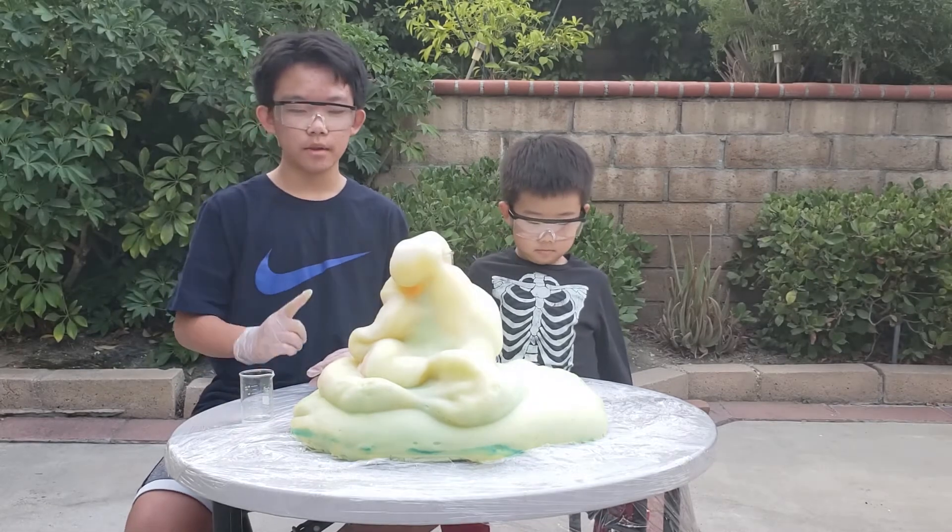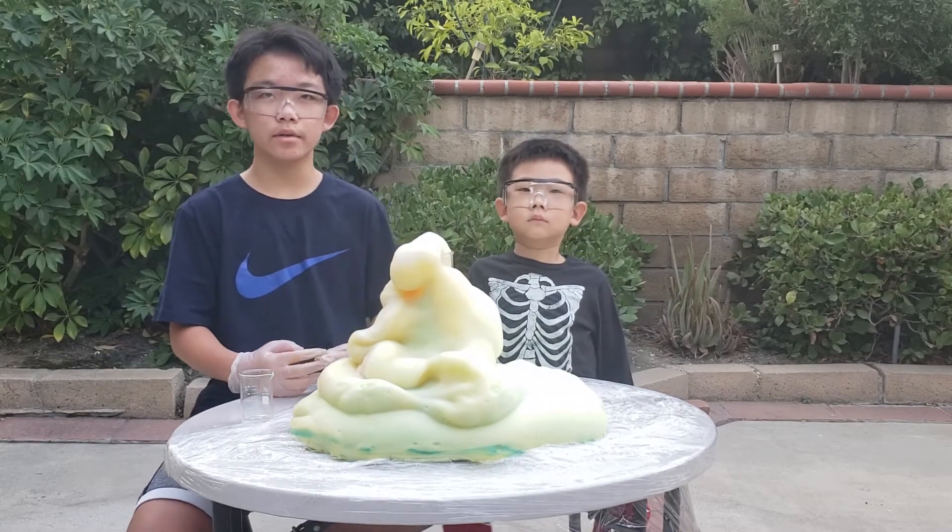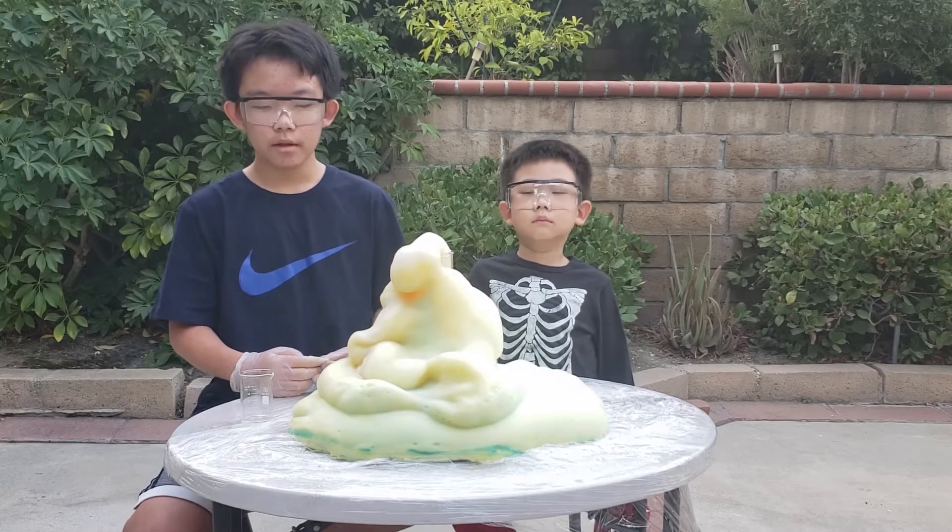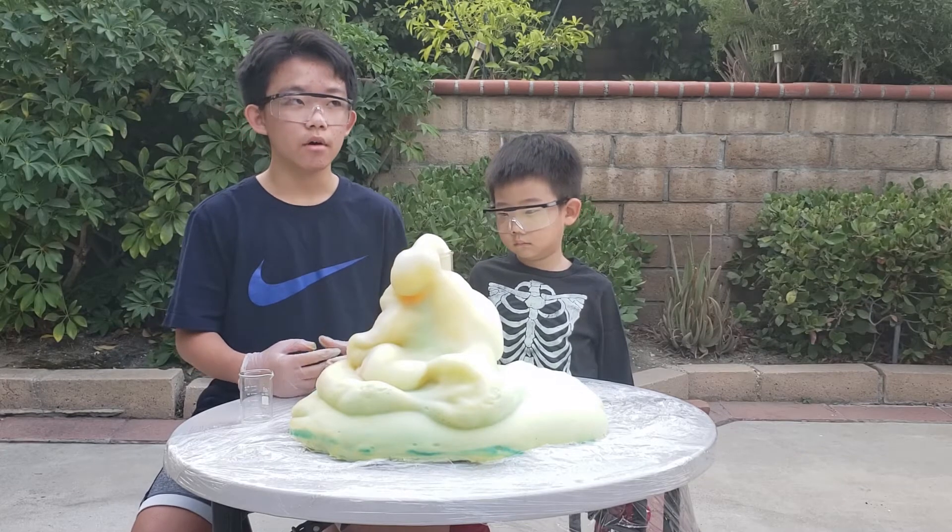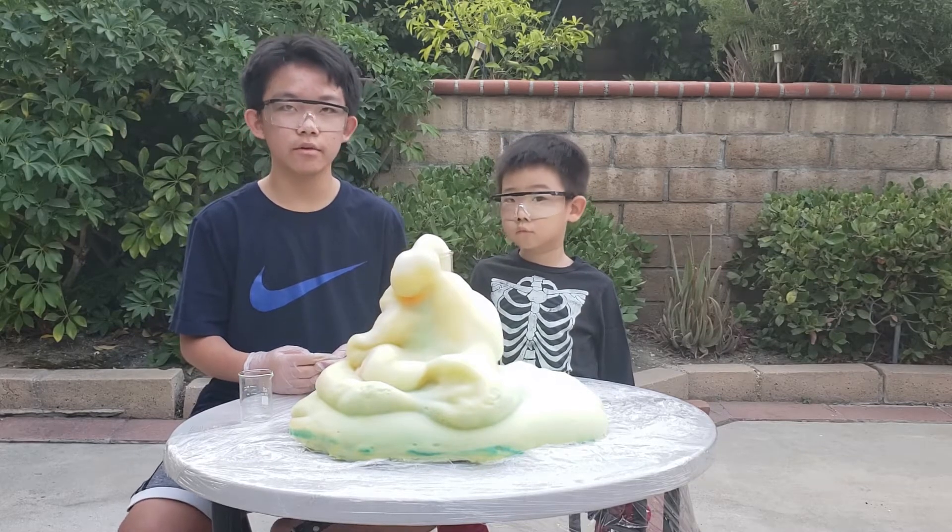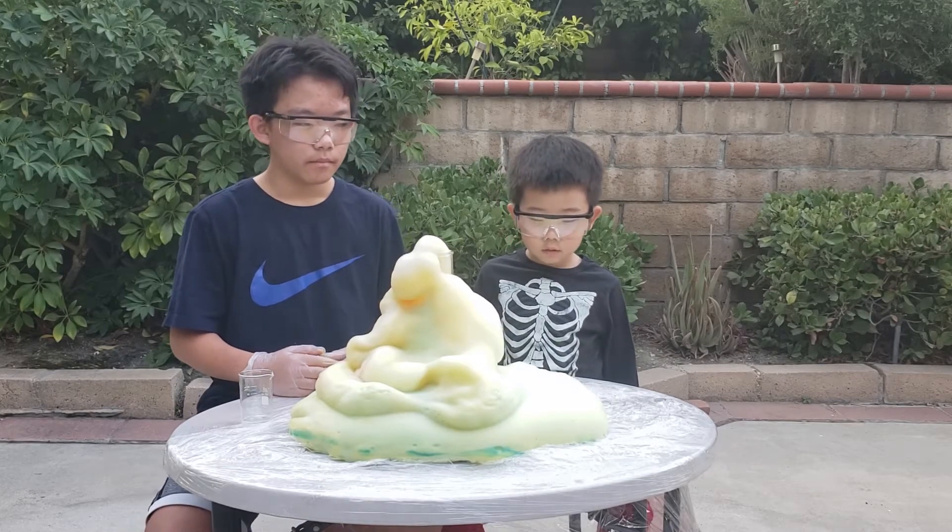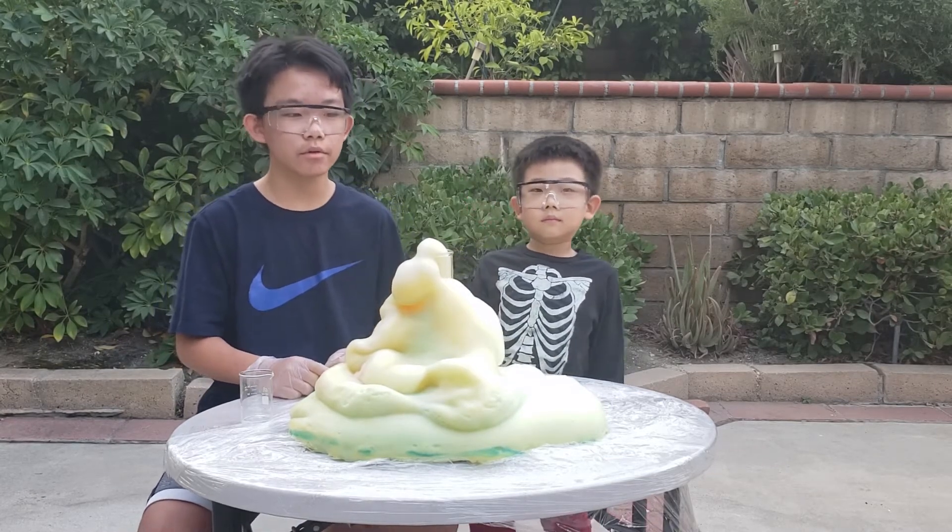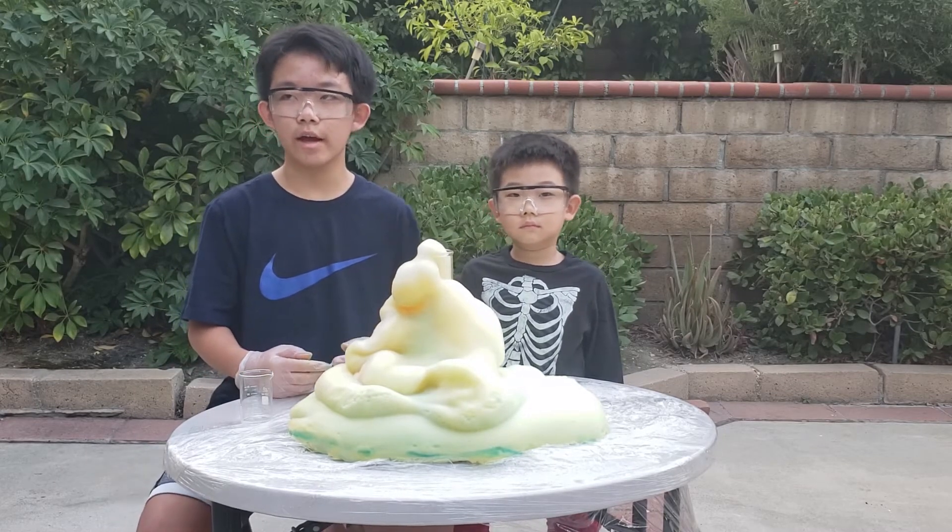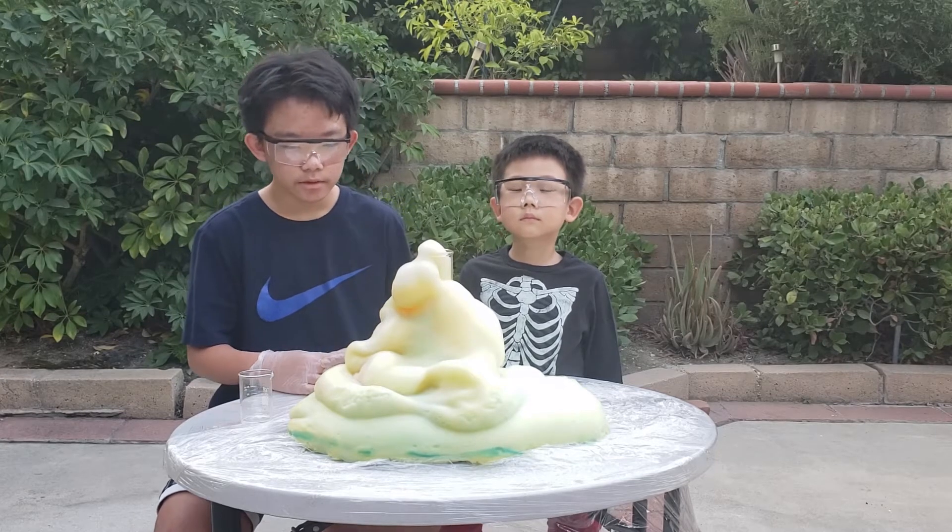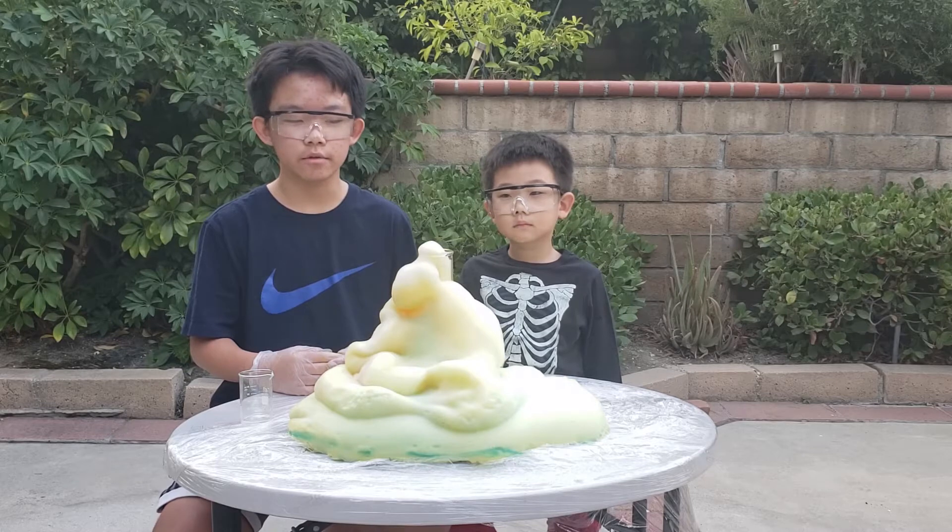There are two things you need to know. One is that the eruption is so hot, and because there's iodide ions involved, it will stain any plastic that's used as their bottom. So always get some plastic wrap around your surface, or else it will be stained yellow or brown. Also, the foam produced here is very hot because the overall reaction released quite a lot of heat. So if you're cleaning up, wait for a little while for it to cool down.